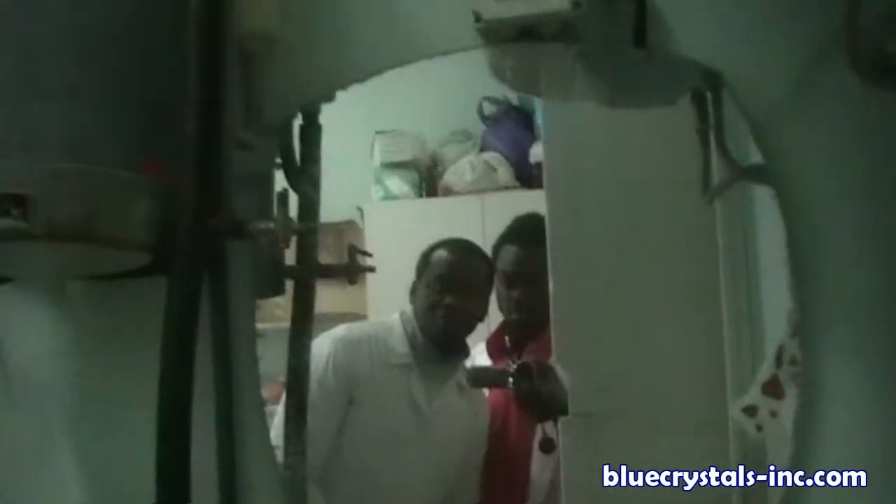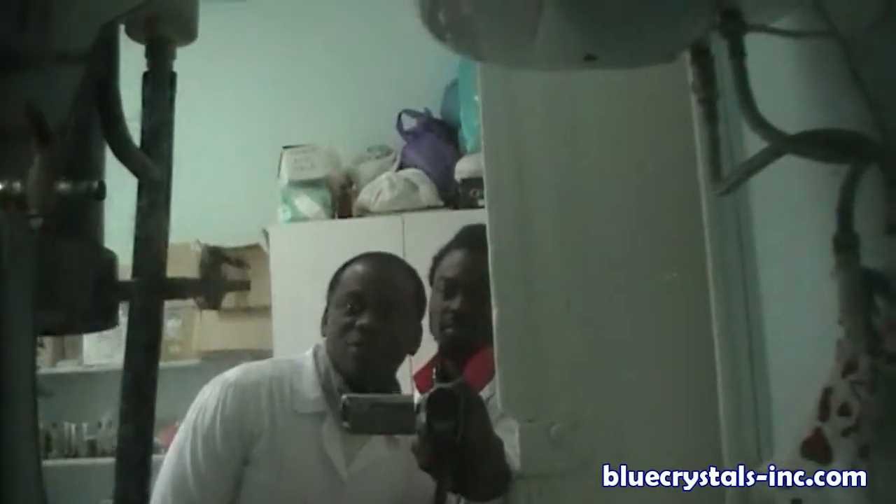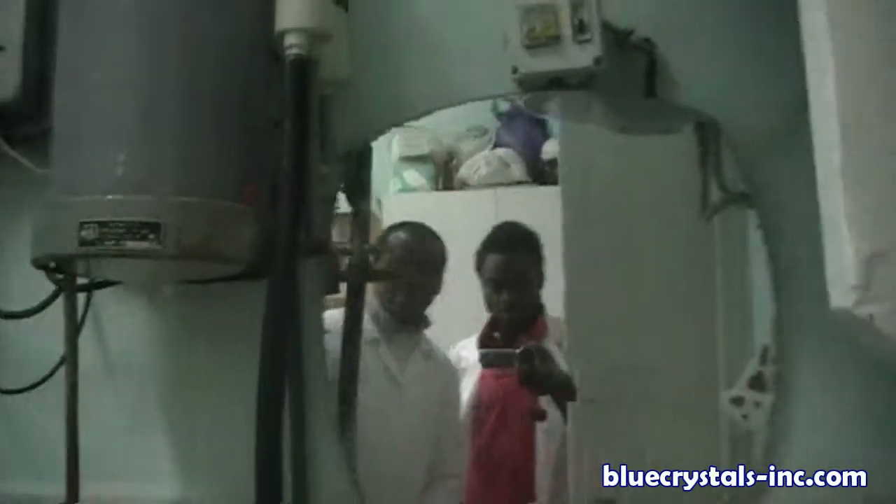The best students here in the university — you can see them. I like to use them. I need to add water. Let's get some water. And that is enough. Thank you.